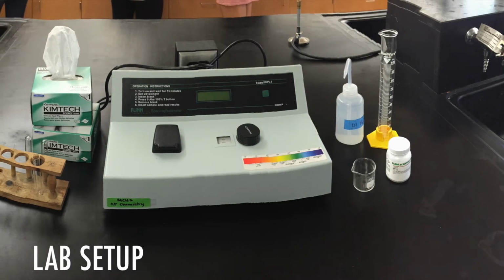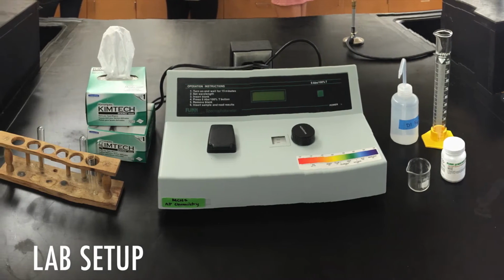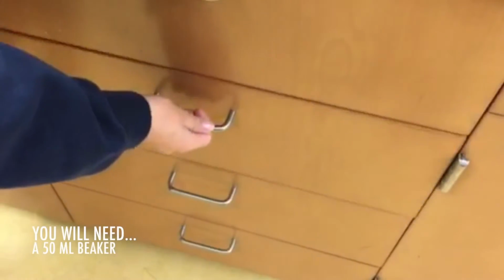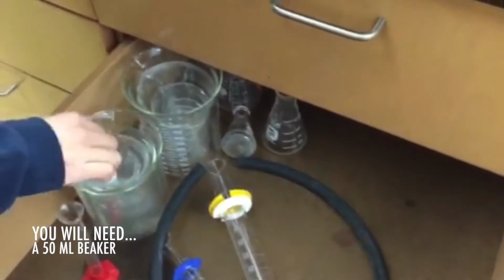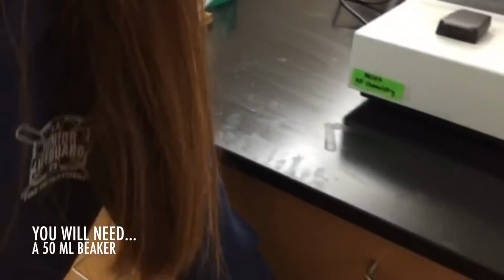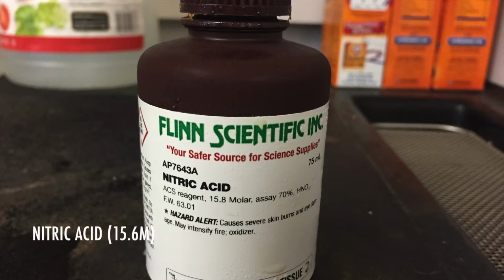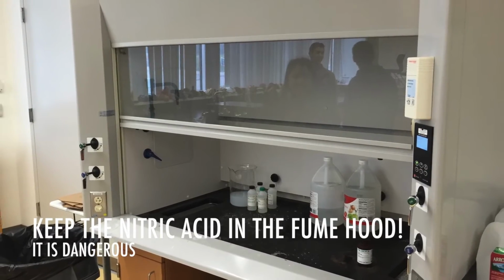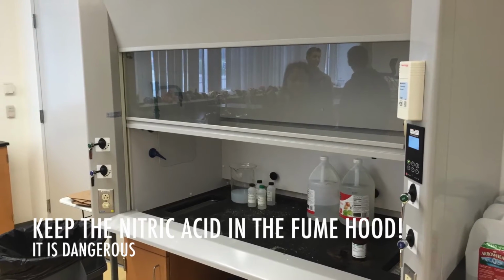Lab setup. You will need a 50 milliliter beaker. Nitric acid. Keep the nitric acid in the fume hood. It is very dangerous.